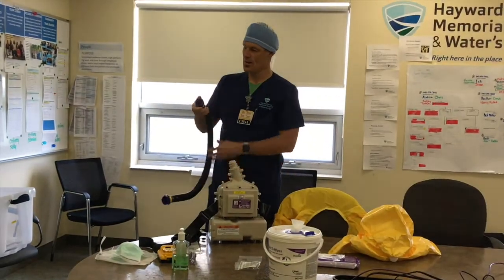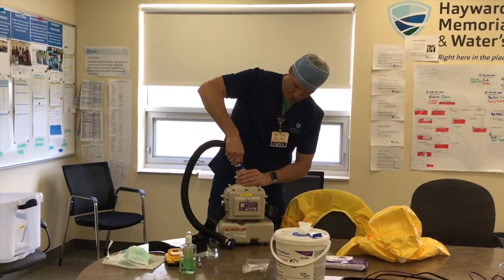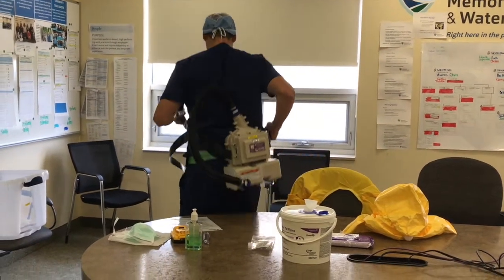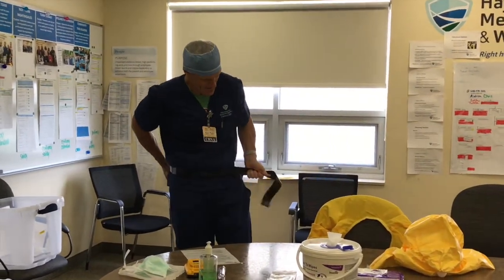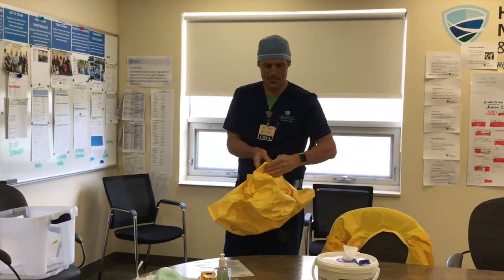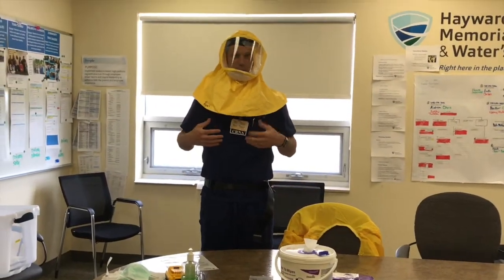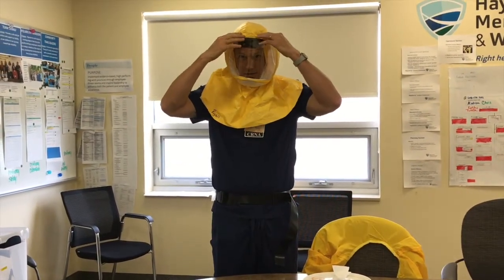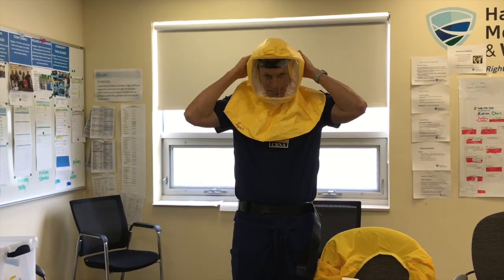Now that I know all my equipment and gear is ready: on the end of this hose there's a little spot that you depress. These two tabs line up like so, and you'll hear it click into place. Next, with this unit being a little heavier, I'm using a countertop — like when you're putting on a big backpack. I've got that on. There's a little curve for lumbar support. Next I'm going to get the other end of the hose and attach that — you'll just hear that click into place. Now that I've placed my hood on, hopefully you can hear me — you'll hear air blowing through. It should fit comfortably right in front of your ears. There is a headband on the top that's worth practicing before you apply. They're adjustable, so the black portion goes in the front. That all feels pretty secure.